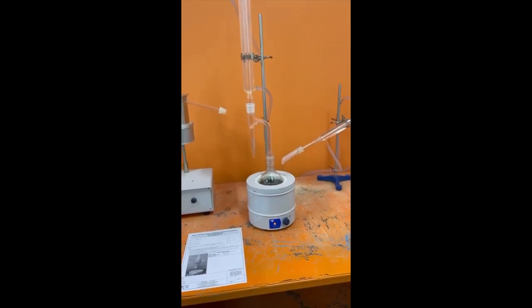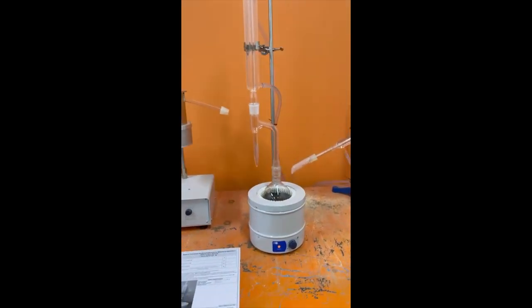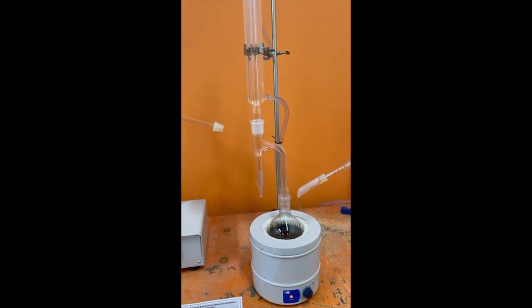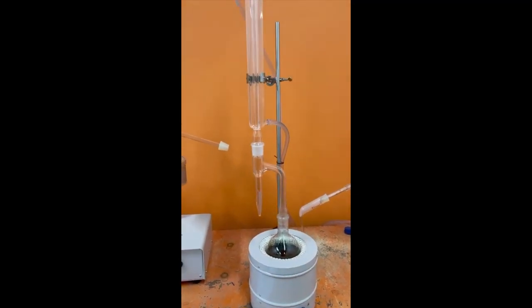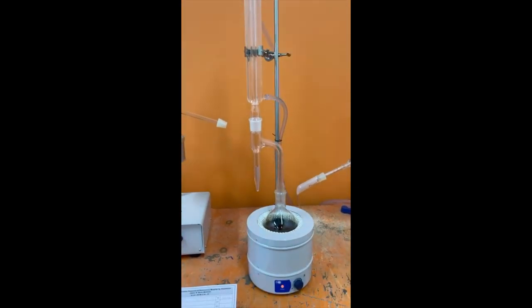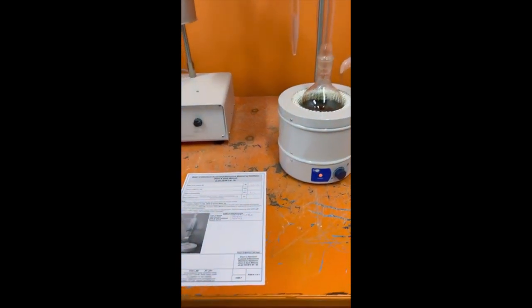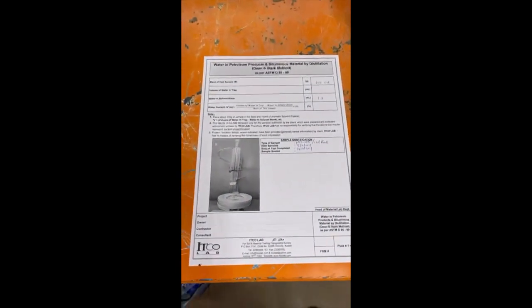Hi sir, here we are doing a test demonstration for water content in bituminous material via ASTM standard D95. Here I used the Dean-Stark method.